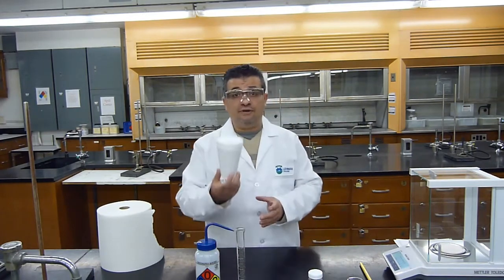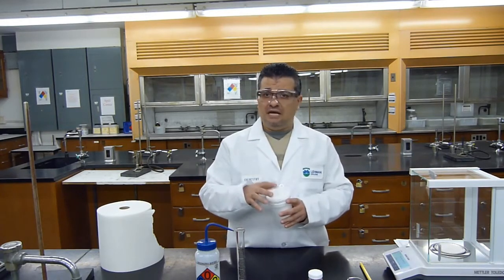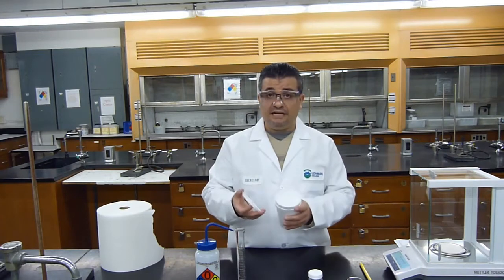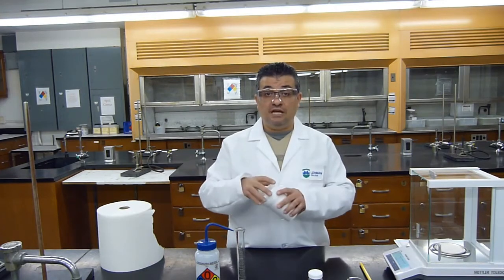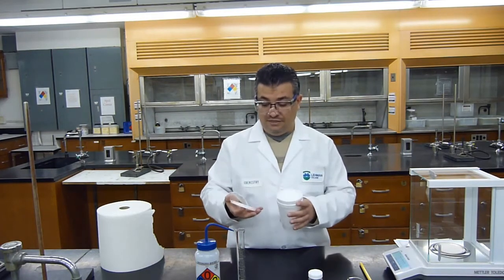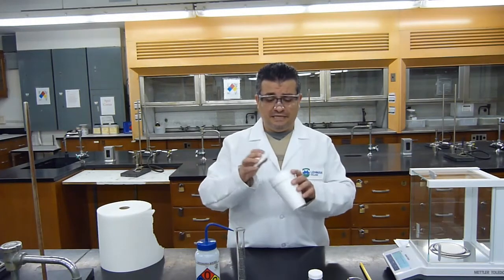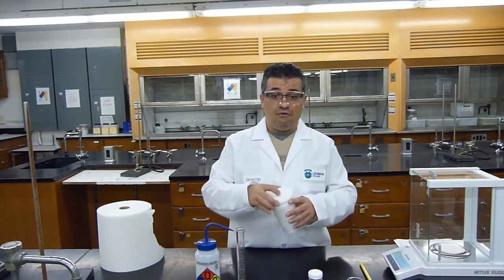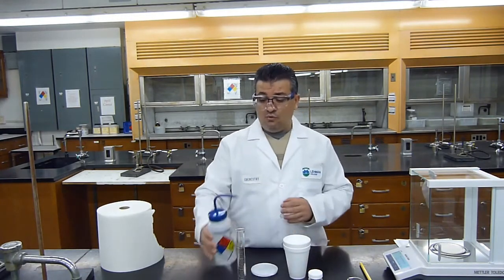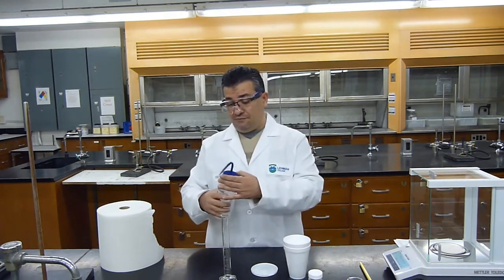First, I already obtained in part A the mass of the calorimeter empty. I don't need to obtain it again unless something went wrong with my cups and I punctured a hole in it, or I'm using different cups and a different lid for any reason. I'm reusing the same ones, so the mass of the empty calorimeter I will obtain from part A, and what I will do now is measure the mass of water by difference.